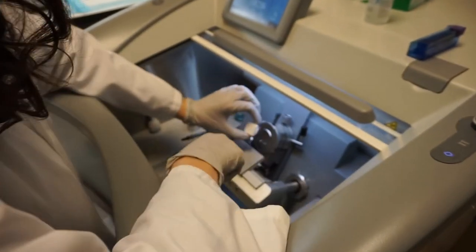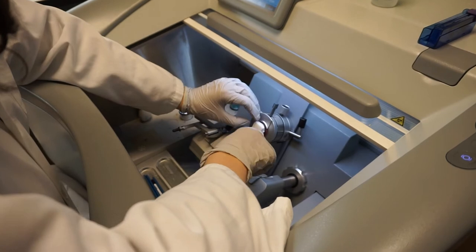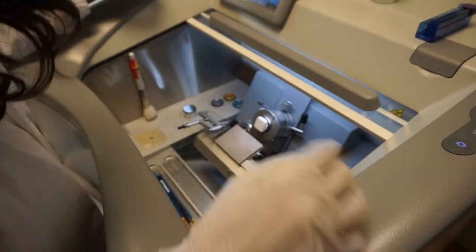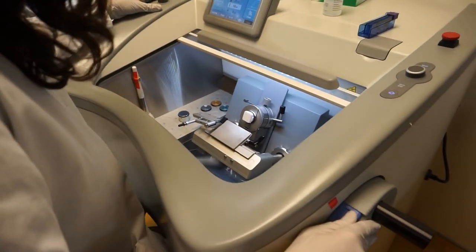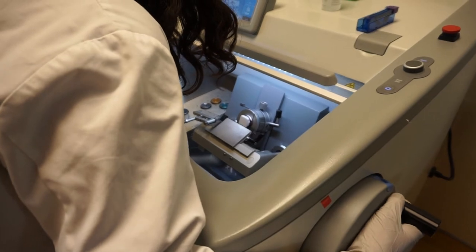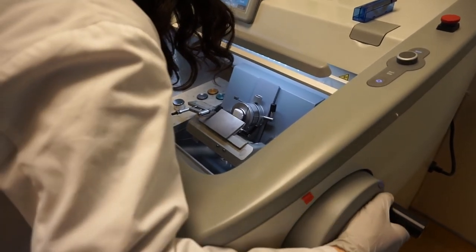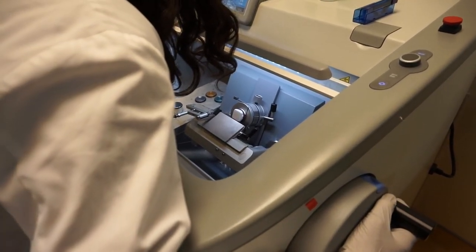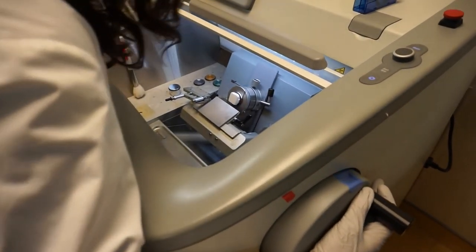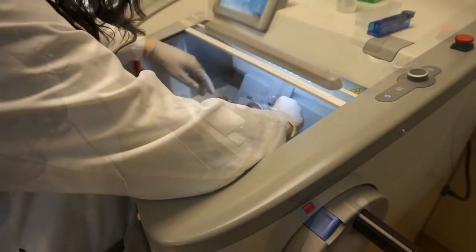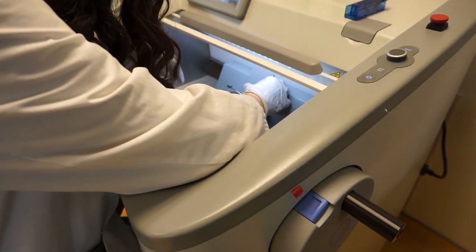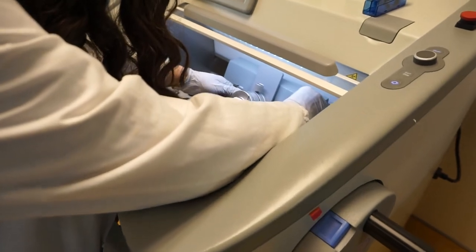Insert the chuck on the specimen head and rotate it so that the block edges are aligned to the head. Bring the blade closer to the block and adjust the vertical horizontal alignment to the blade. Approach the block until one part of it touches the blade. If any part touches, release the headlock lever and adjust alignment so the block no longer touches the blade. Approach the block further until it touches again and repeat the previous steps.